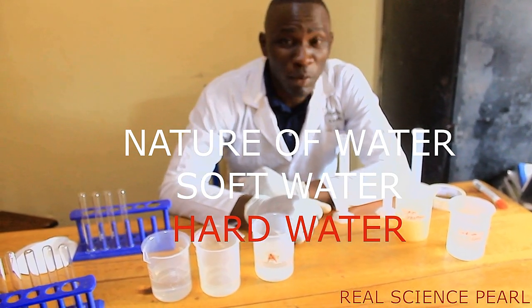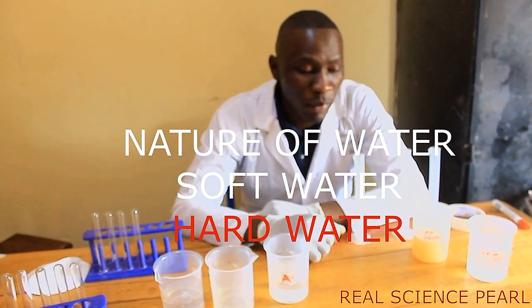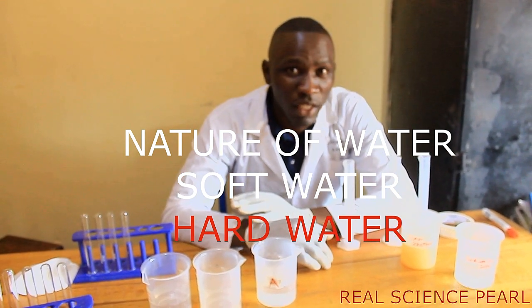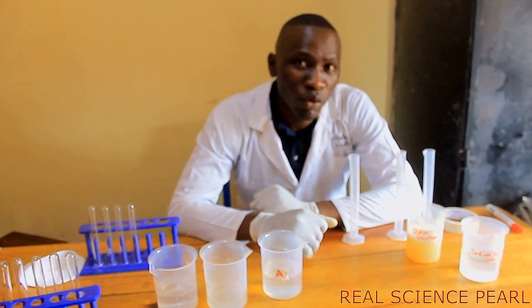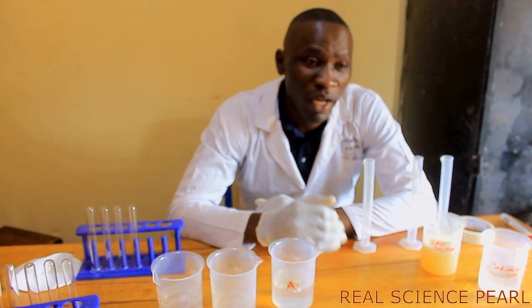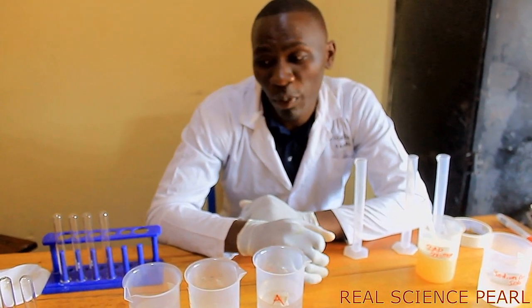In this video, I'm going to show you hard water and soft water. This practical experiment we are going to do is going to help us to know which one is hard water, which one is soft water, and how we can soften hard water. Remember, soft water is the type of water that forms foam easily with soap. However, hard water doesn't form lather easily with soap. In turn, it forms scum.